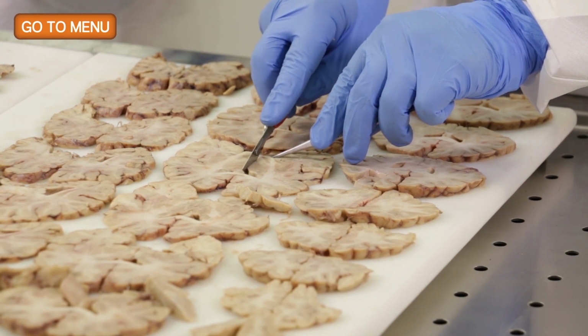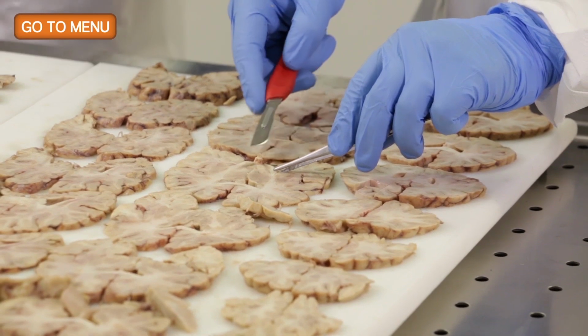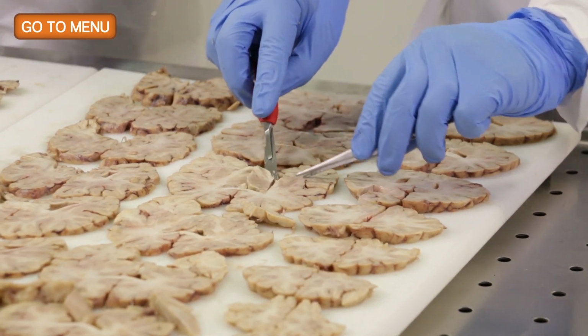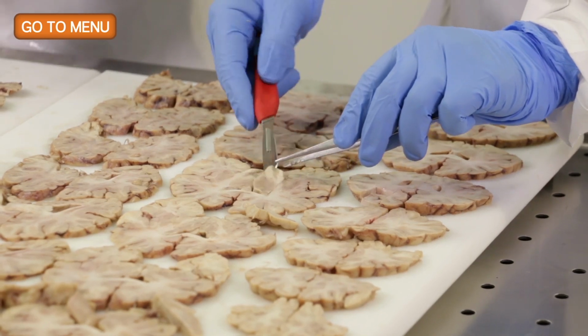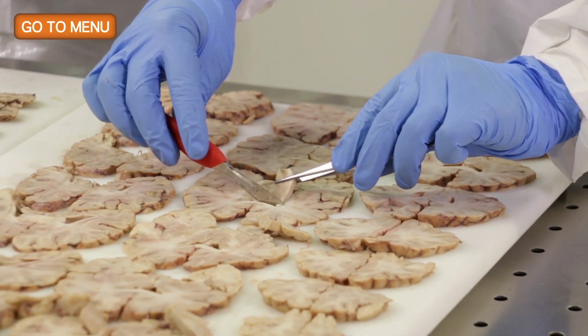Because your cuts are always going to be a little bit asymmetrical, you don't have to stick with the left or the right. It's best to actually just take the section that has the most ideal cut. So it's okay to switch from left to right as long as you write it down and make a note of it.